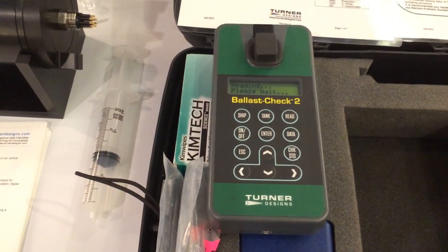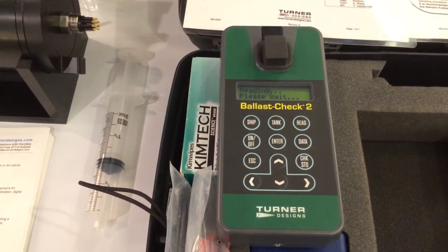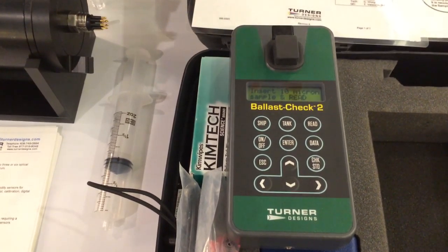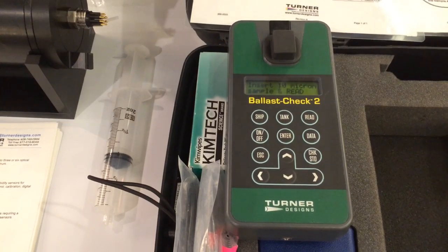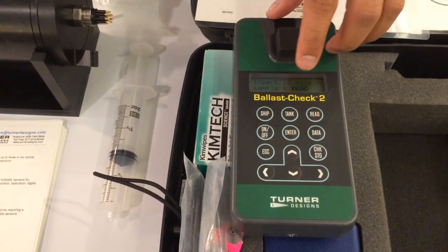It's going to tell you whether you have a high amount of fluorescence or a low amount of fluorescence, and that correlates to how much algae are in the water.